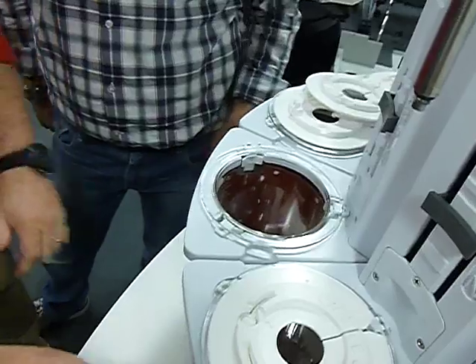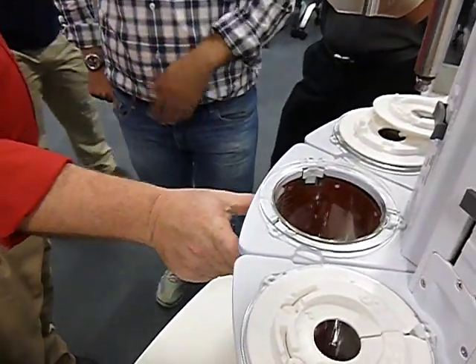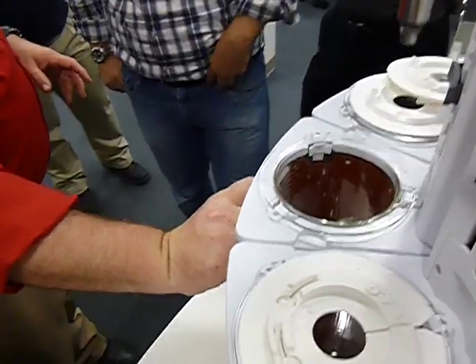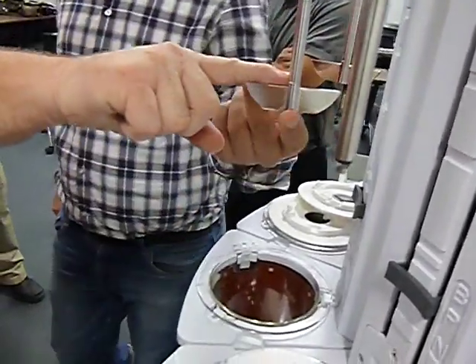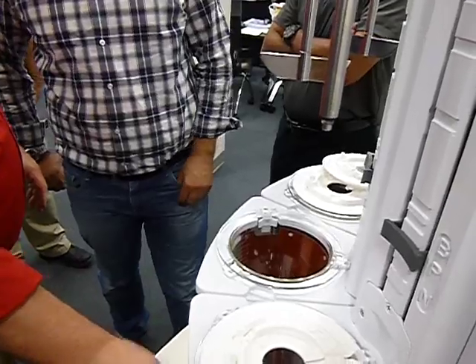But I mean, there is no part number for the sensor and part number for the heater. There is no sensor on here. Not on these. This has just got a heater. It's a two-stage heater. There's a heater inside here, a lower heater and an upper heater. The sensor is inside the shaft itself. Okay, so no sensor inside here.